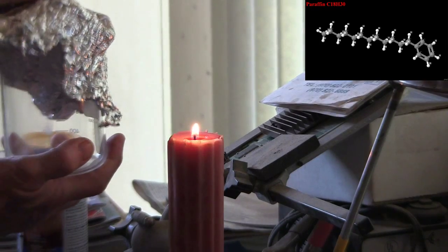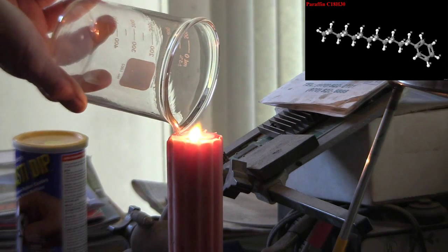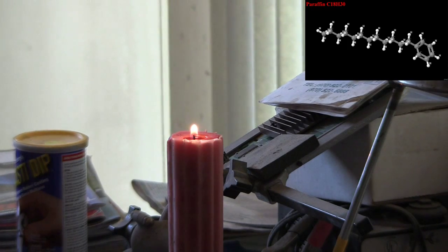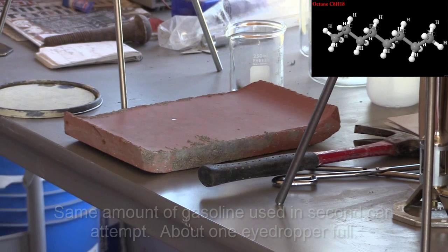Again, if I surround the flame by pure oxygen, the combustion is much more vigorous and complete, as you can see. Note that the combustion is still not truly complete, as indicated by the yellow color of the flame. But the paraffin gas does burn much better when there is plenty of oxygen available.